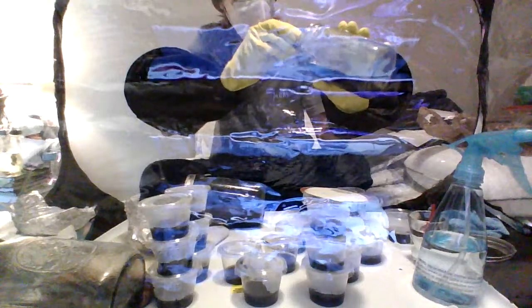I may not be able to show this the best, considering I'm using a webcam. So I'm just going to explain it as best I can. This is now on the bottom of this, right? The point is we're going to try to create a trench in between that sample and the rest of the agar. So I'm going to quit talking and just do it. Oh, I ended up pulling the whole thing off. Whoops. It's okay.